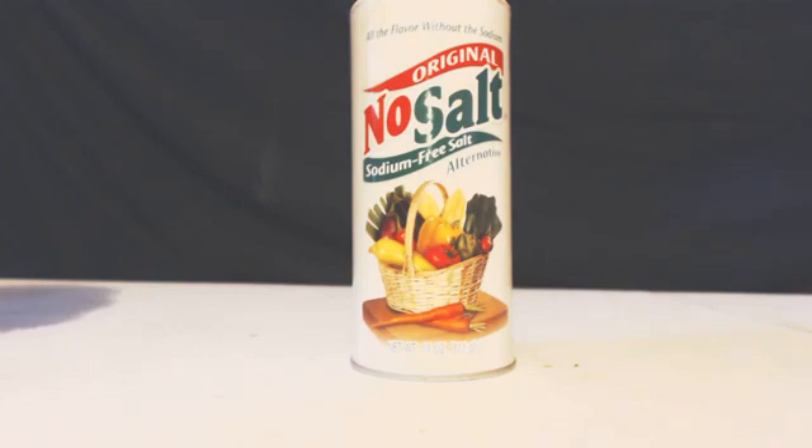There's going to be some anti-caking agents in there probably, but if you recrystallize this once, wash it with some ice-cold water, and dry it out, you have nice ultra-pure potassium chloride. It's a good thing to have, but I wouldn't waste it — if you can use sodium chloride, it's always best because it's so much cheaper.